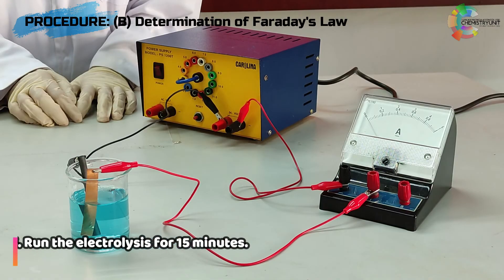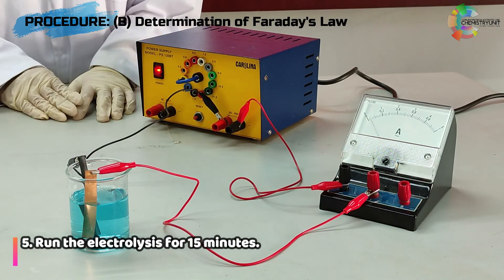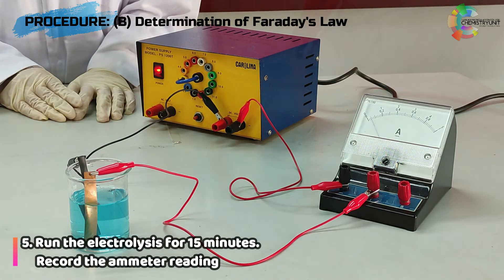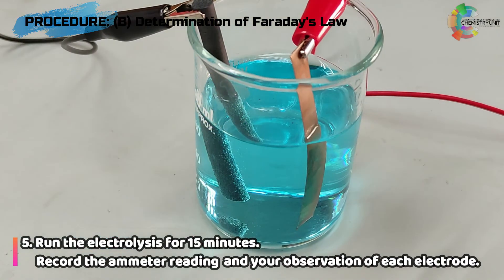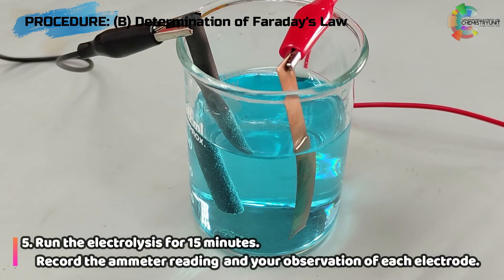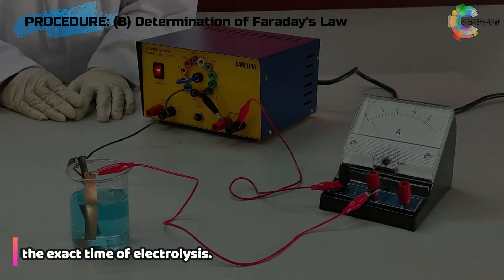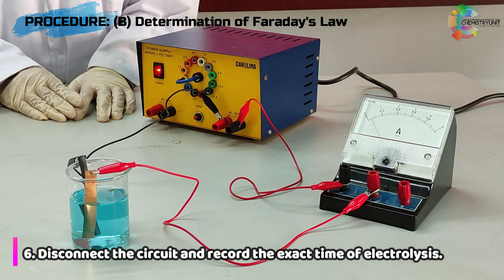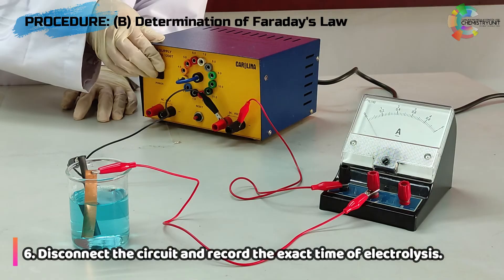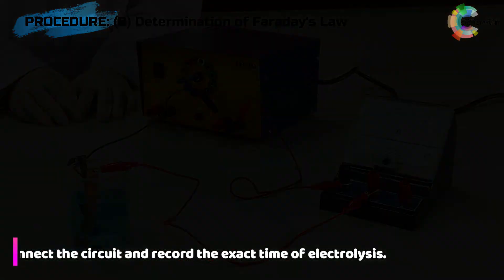Run the electrolysis for 15 minutes. Record the ammeter reading and your observation of each electrode. Next, in step 6, disconnect the circuits and record the exact time of the electrolysis.